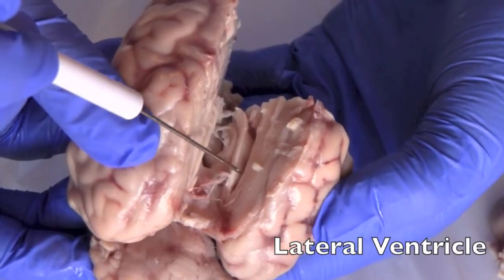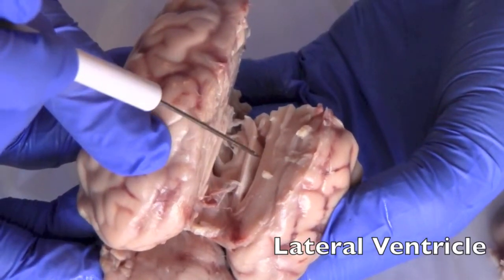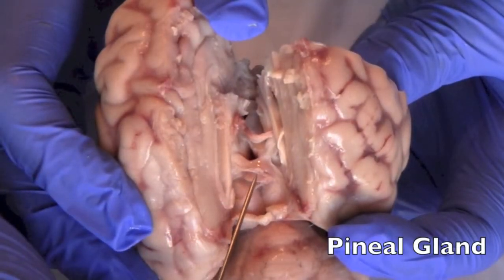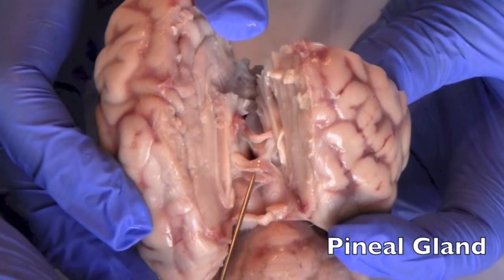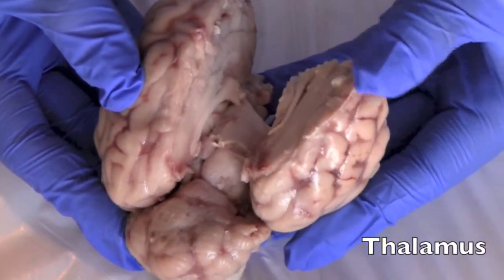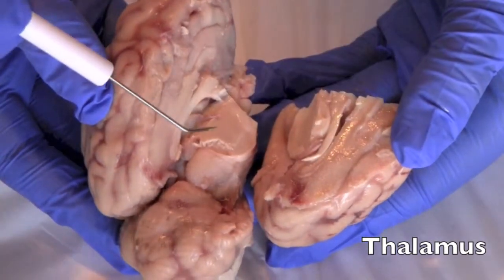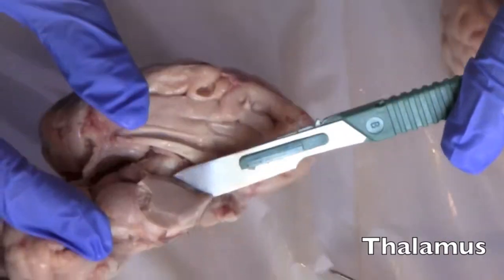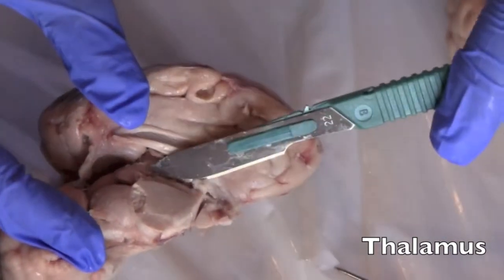This right here is the lateral ventricle that holds the spinal fluid. This right here is the pineal gland that deals with the circadian rhythm and sleep. Now we're going to split the brain to get to the thalamus. And its function is the sensory station of the brain. So now we're going to cut in between here to see the other side of the thalamus.